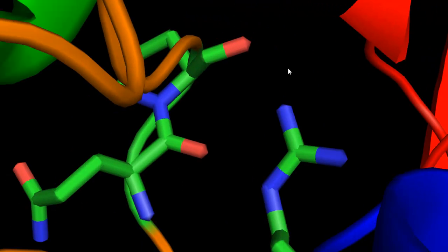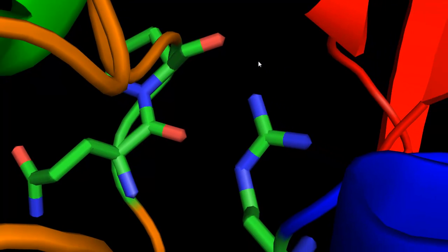Now, let's say you're doing some kind of antibody engineering. You want to really kind of look at this area and this residue specifically. So you've done all this and you really want to say, okay, well, I think this residue, arginine 98, is extremely important for this antibody in order to recognize the Ebola virus glycoprotein. And you want to start mutagenizing it. Well, you can actually start mutagenizing this residue in Pymol itself. This process is called in silico mutagenesis. In silico just basically means using the computer to do some kind of a simulation.